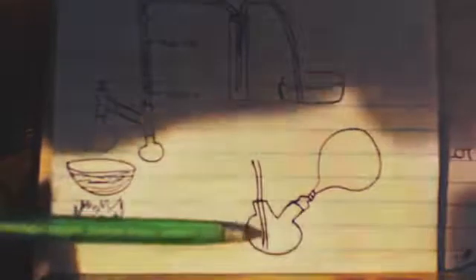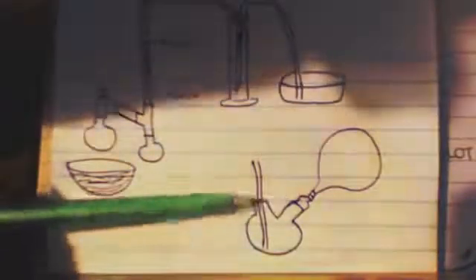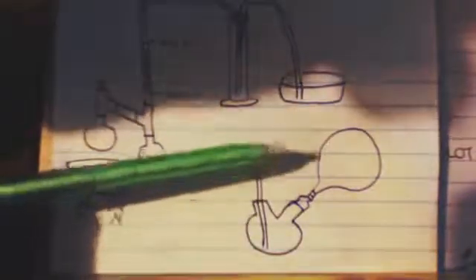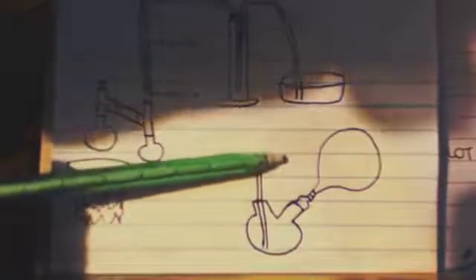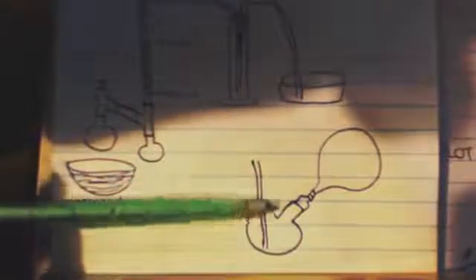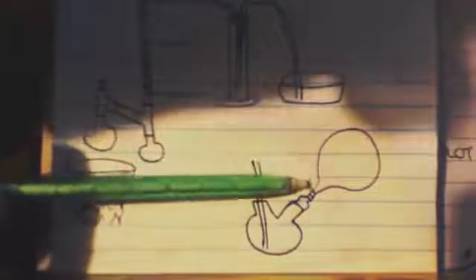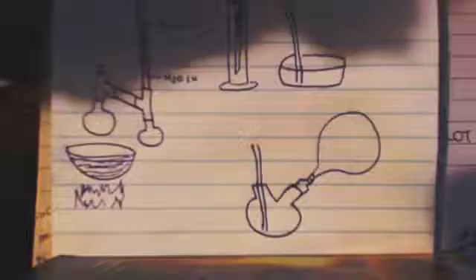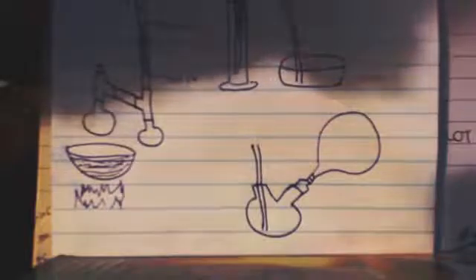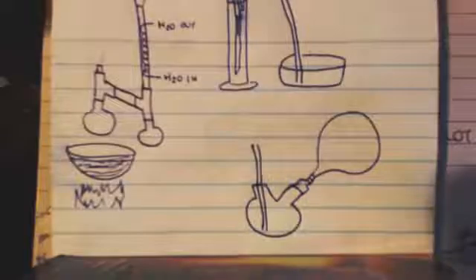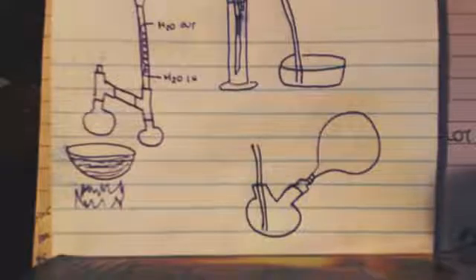Because of the elasticity of the rubber, you can see if it's reacting. As it reacts, the balloon will get smaller because the gas will turn into a solid or a liquid through this reaction. The balloon will get smaller and smaller and you'll be like, oh, the reaction is going forward. Is it really worth it? Carbon dioxide is almost free, so not really.